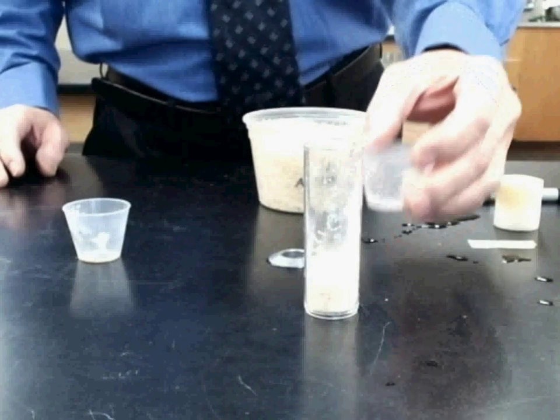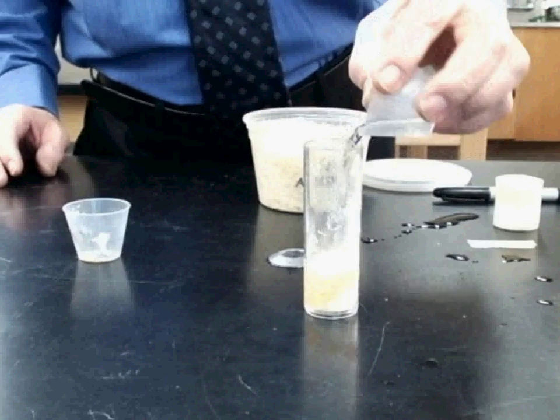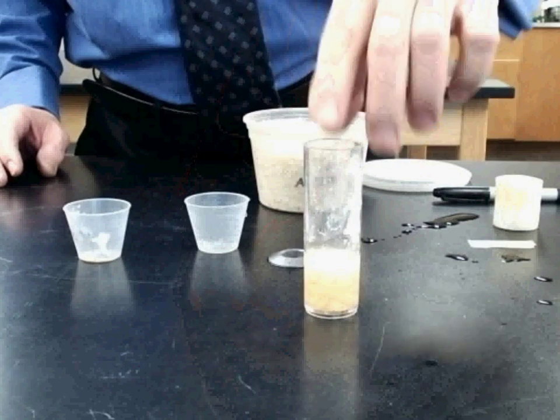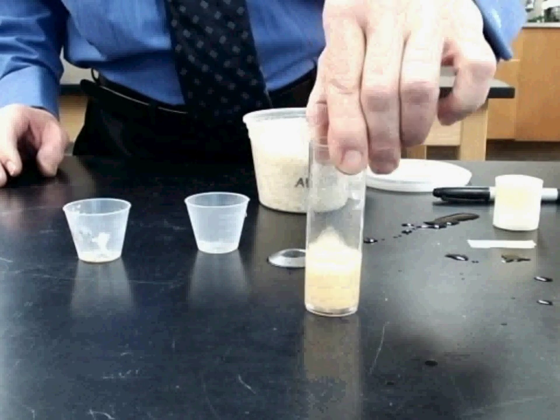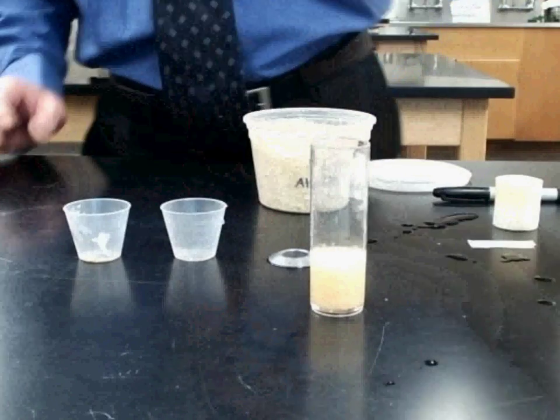Okay. Then, you add the water directly to the media. Give it a little swirl and let it sit.